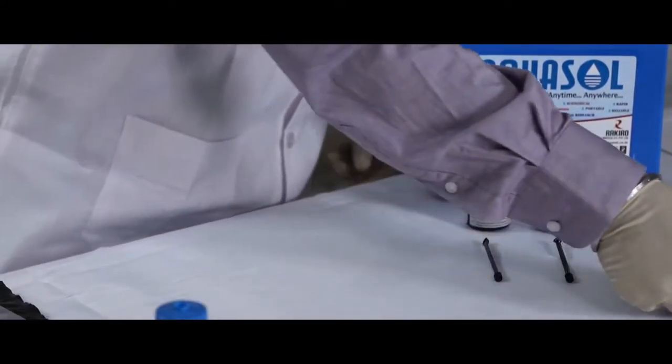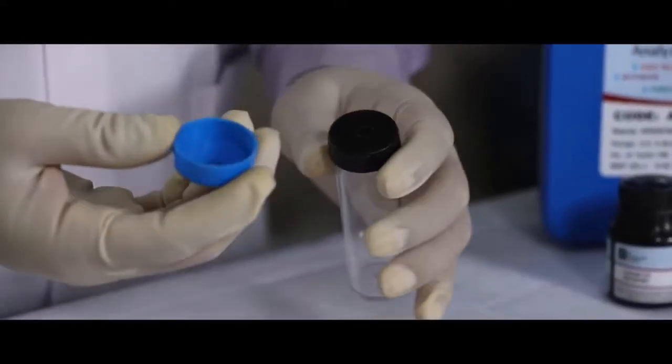Please read the procedure card to follow the instructions. To begin the test, remove the blue cap of the test bottle.